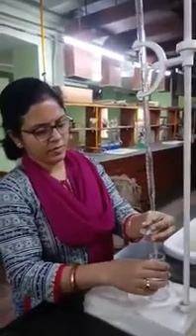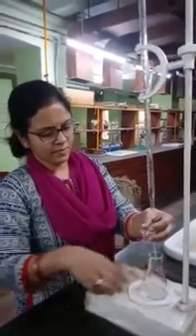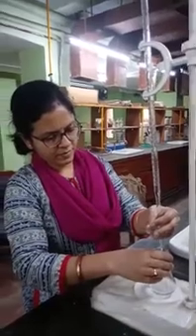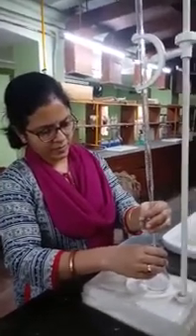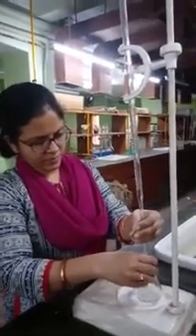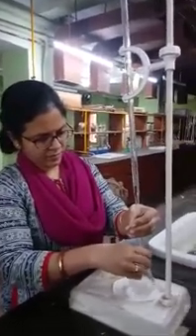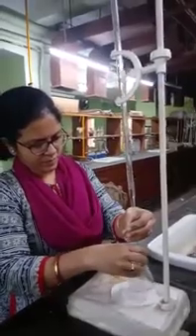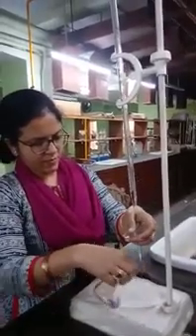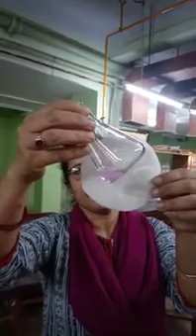But because formalin can undergo aerial oxidation, the formalin solution is first neutralized by sodium hydroxide solution. If formic acid is formed, it is neutralized by sodium hydroxide solution. Pipette out 10 ml of formalin solution, add 2 drops of phenolphthalein as an indicator, and then titrate it against sodium hydroxide from the burette. The appearance of the faint pink color shows the endpoint, that the formaldehyde has been neutralized. See, this is the faint pink color that you can see, which is the endpoint of formalin neutralization.